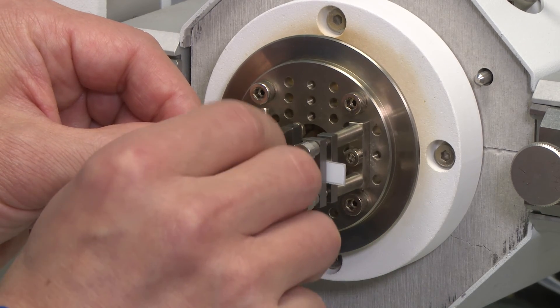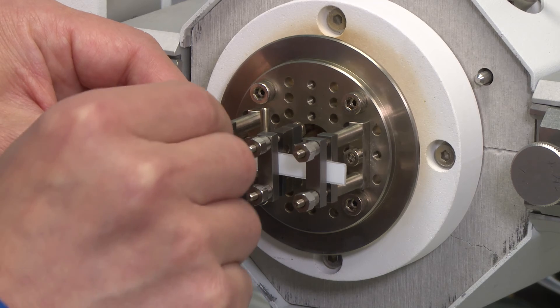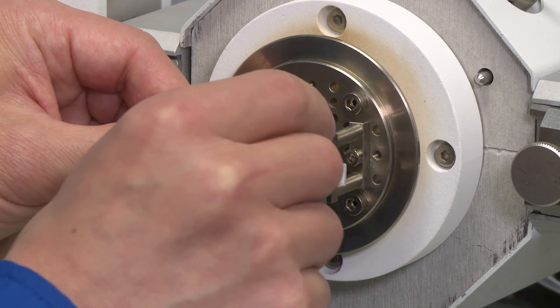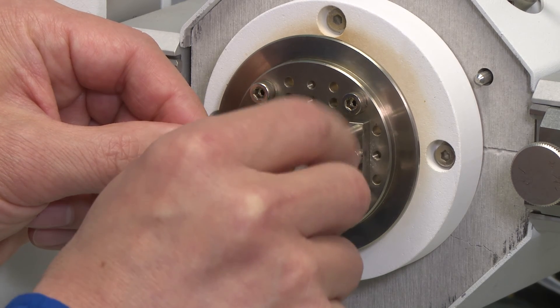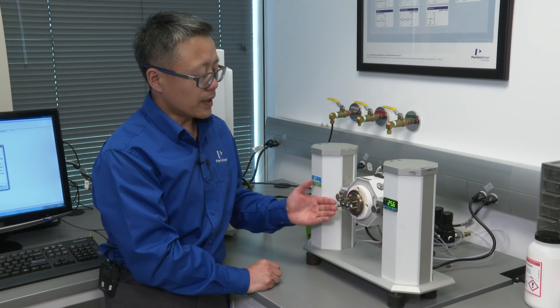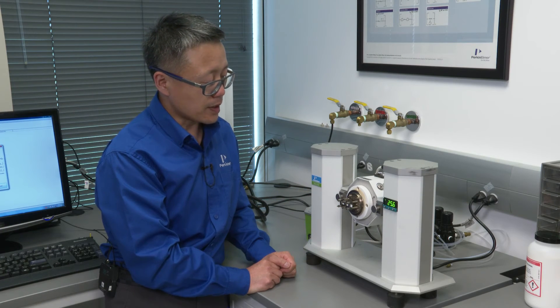While holding the sample at the center position, you can tighten the nuts to make sure the sample is clamped well.